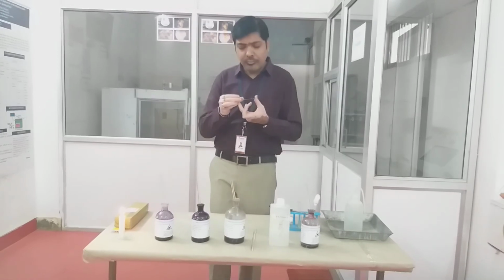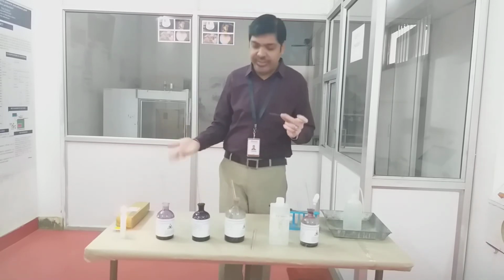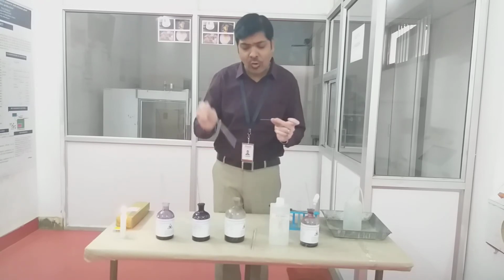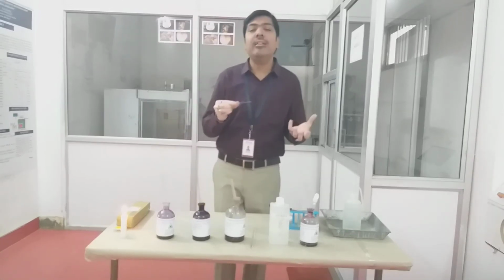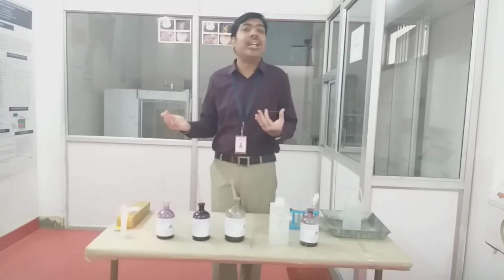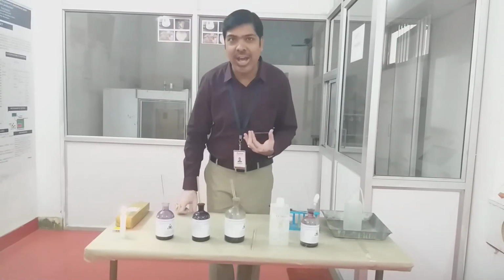Okay. Now after the addition of the crystal violet and waiting for some time, what do we have to do? We have to add the second stain, which is called Gram's iodine. We have already covered in our theory that when we add crystal violet and then Gram's iodine, it results in the formation of a complex called the CVI complex. So whatever cells are available, whether Gram positive or Gram negative, both categories of cells will form the CVI complex.